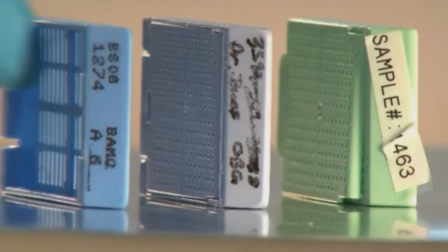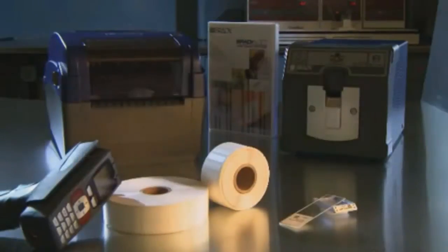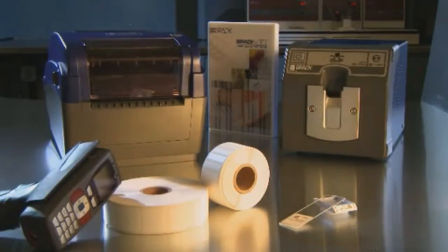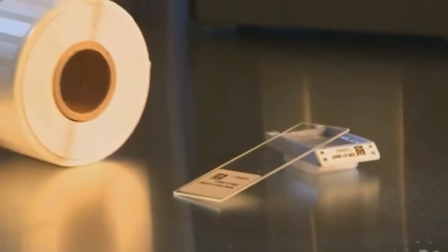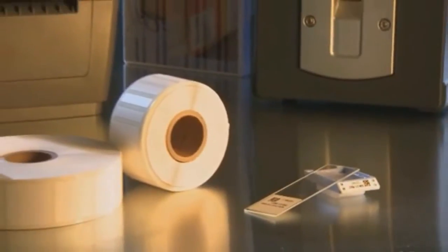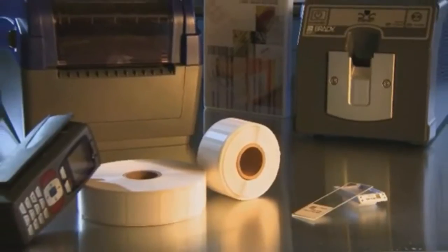Handwritten, smudged, and unidentifiable cassettes are a thing of the past, thanks to Brady's specimen labeling solution for histology and anatomic pathology. It's the complete labeling solution for small to mid-sized tissue processing labs, labs wanting solutions at multiple stations, or as a backup to high-volume systems.